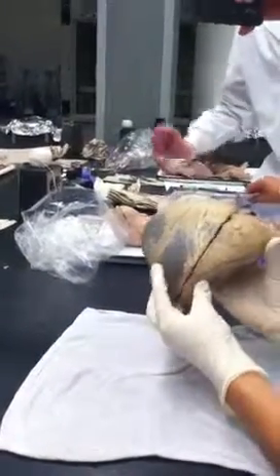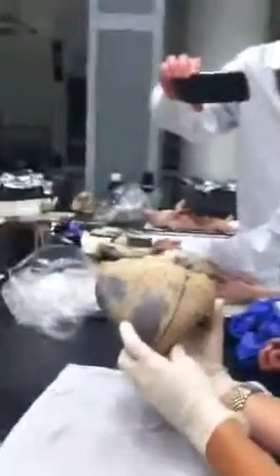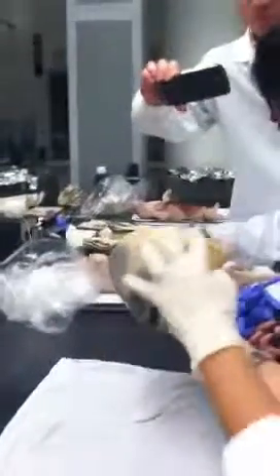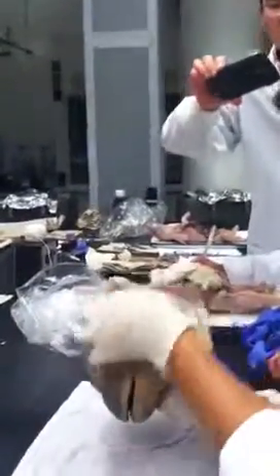Anyone know what this kind of point is called? Apex. Yeah. Good. So Apex. A-P-E-X. I'm dyslexic, so that was really difficult. I got it right, right? Yep. Okay, so if you see the left side is a lot bigger, I'll explain why that makes sense in a second. But just so you know, the left side is really big, the right side's kind of small.